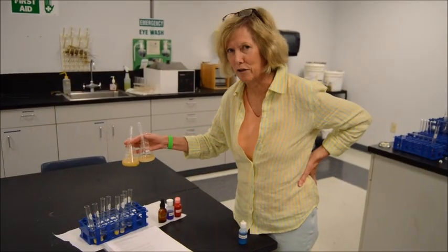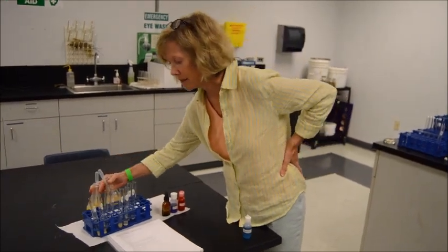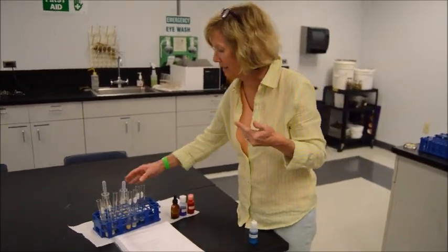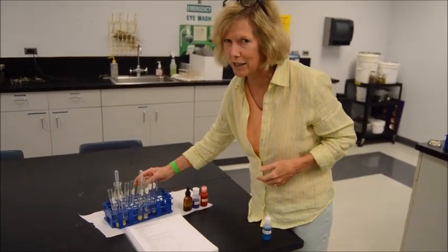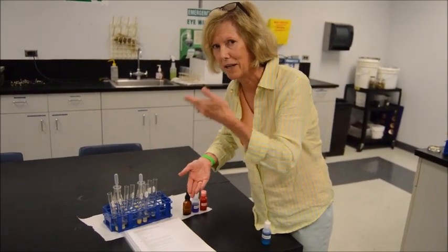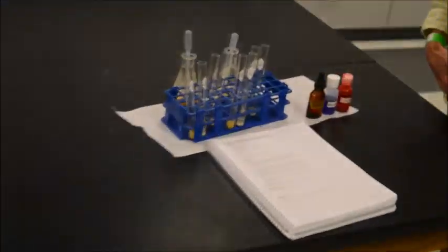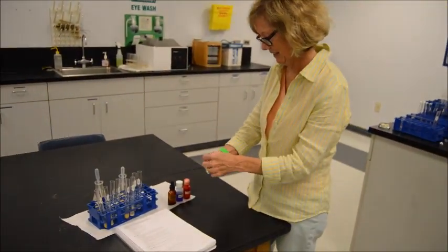Well, since both of these are food substances, we know they're safe, they're something we would consume. We can smell them like you would normally smell something. For those of you who've had chemistry lab experience, you know we're really supposed to waft things and use our hand to bring the scent up to our nose. So we cheated a little bit today because of the type of item we use. But if we were using chemicals like maltose and things like that, we would have to follow the chemistry safety technique. The idea is, if it's something potentially dangerous, you don't want to directly smell it. We're being safe because if we're in an intense environmental lab or something, we're going to be far more careful than this. This is just good old-fashioned biolab.